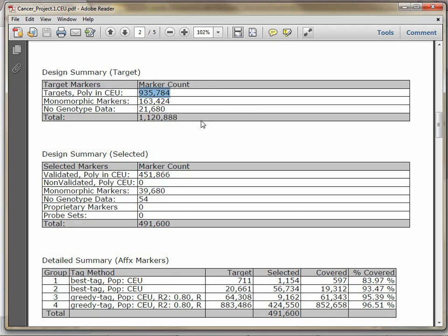So overall, we've expressed interest in 1.1 million markers with our 4 marker groups for this design. One thing to note is that in blue or highlighted are 935,784 markers. These are markers that have been shown to be polymorphic in CEU. This number is important because when we do our coverage calculations, we have to have genotype information, and the markers have to be polymorphic. If they aren't polymorphic, we can't calculate an R-squared value, so we can't tell you whether one marker is covered by another if it's not polymorphic in the population.